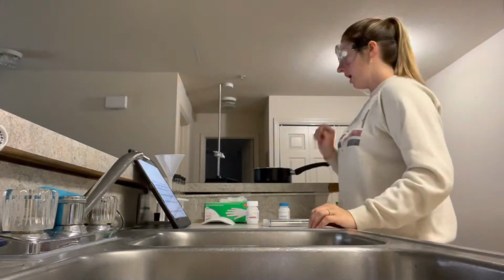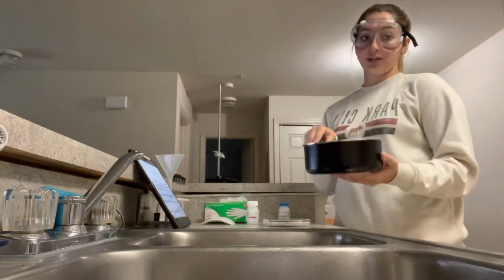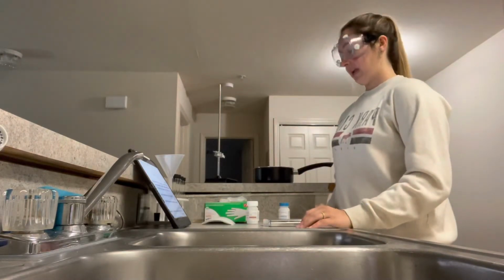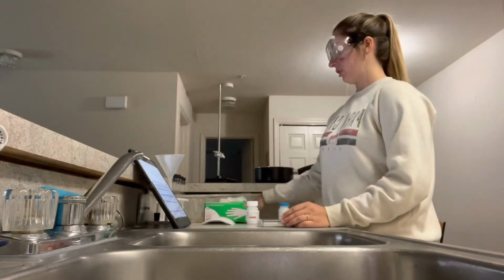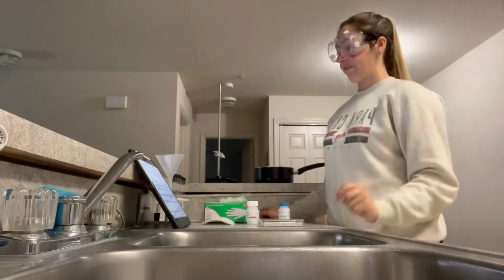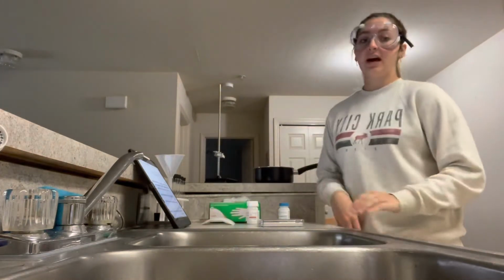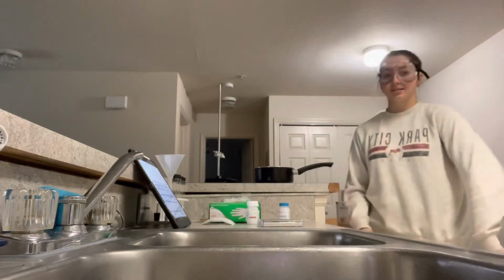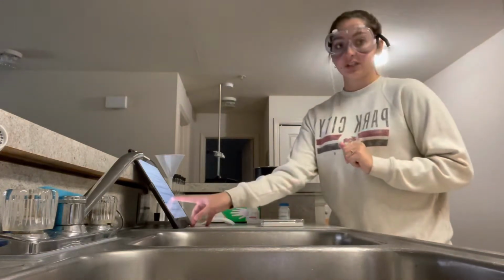A stovetop pot or 400 milliliter beaker on a hot plate. I'll be using a pot on my stovetop because I do not have a hot plate. And a balance, 2 thermometers in degrees Celsius, a videotape, which is my iPhone, gloves, goggles, and I am properly dressed for this, closed-toed shoes, long pants, all of that because we are working with hazardous chemicals.